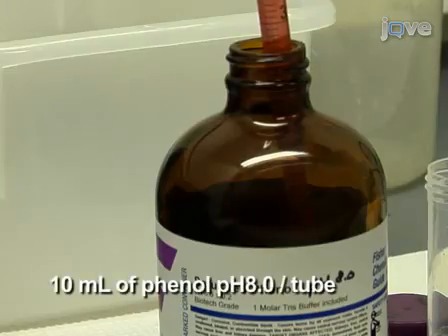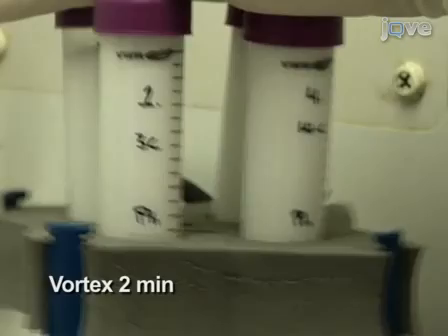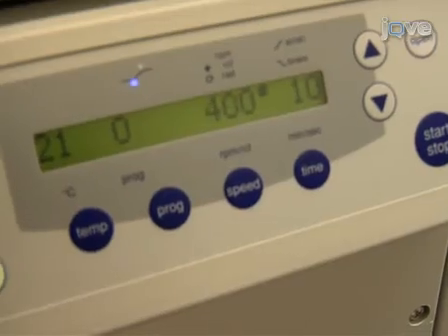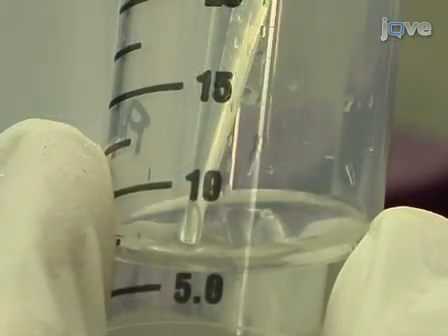Purify the DNA in these tubes by performing a phenol extraction. Add 10 ml of phenol and vortex for 2 minutes. Spin the tubes for 10 minutes at 3,500 RPM and carefully transfer as much of the aqueous phase as possible to a new 50 ml tube.